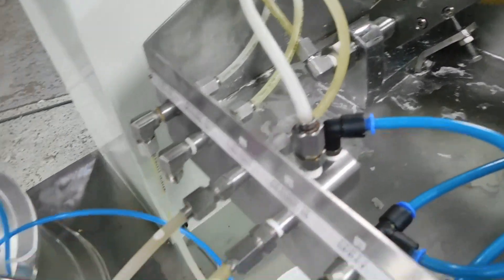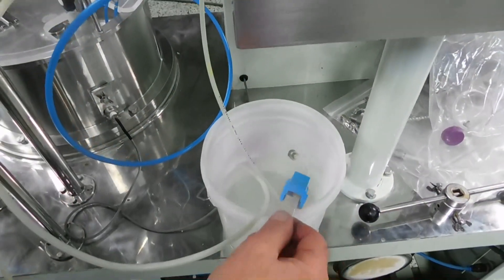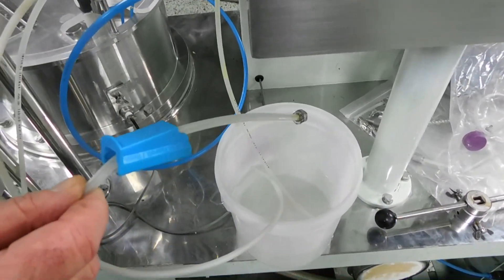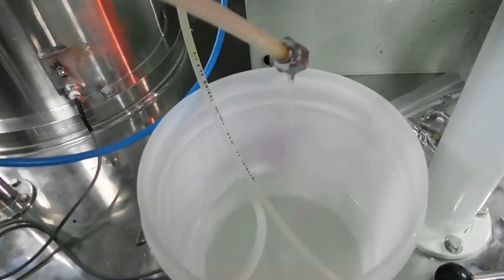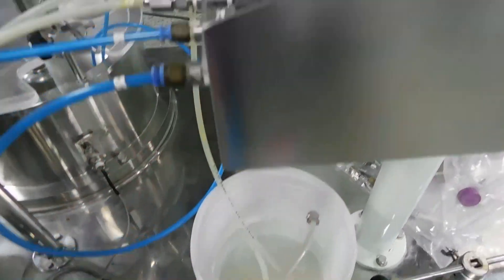I have the nozzles right here. So the flow isn't really that much. It's just a small flow. Remember, you're feeding a spray nozzle, so you don't want too much of a flow.